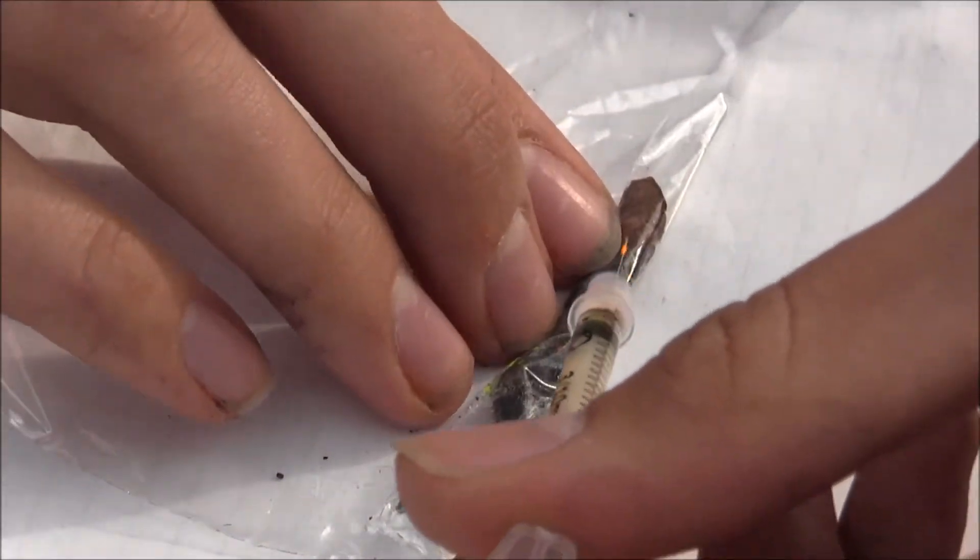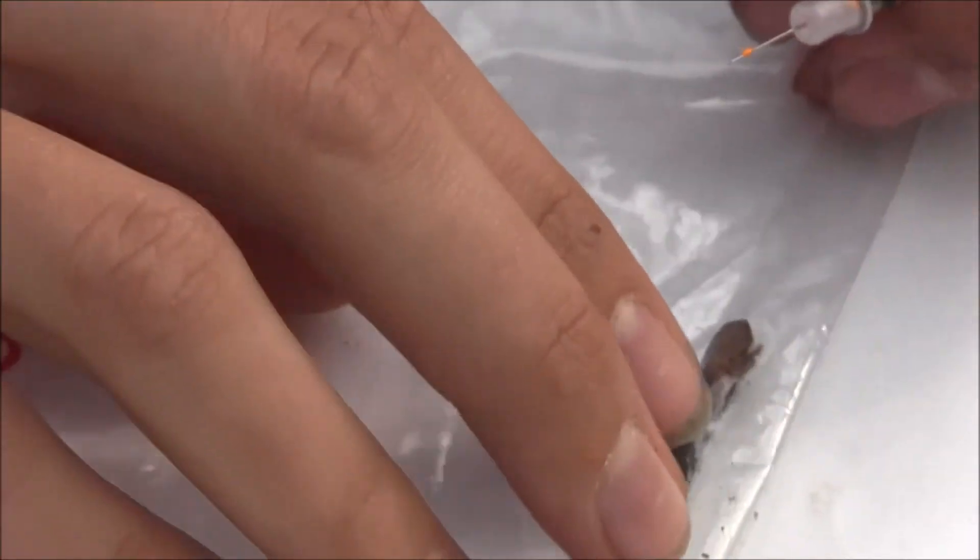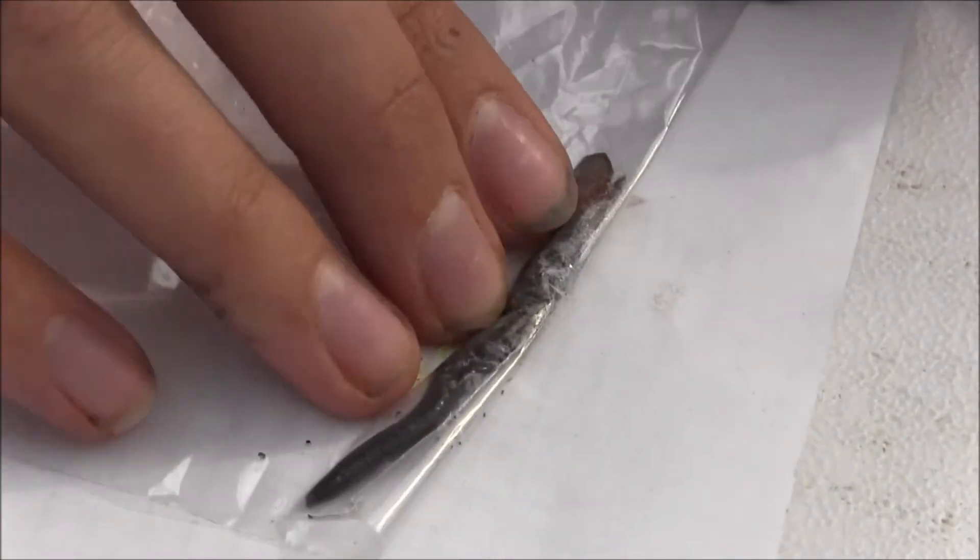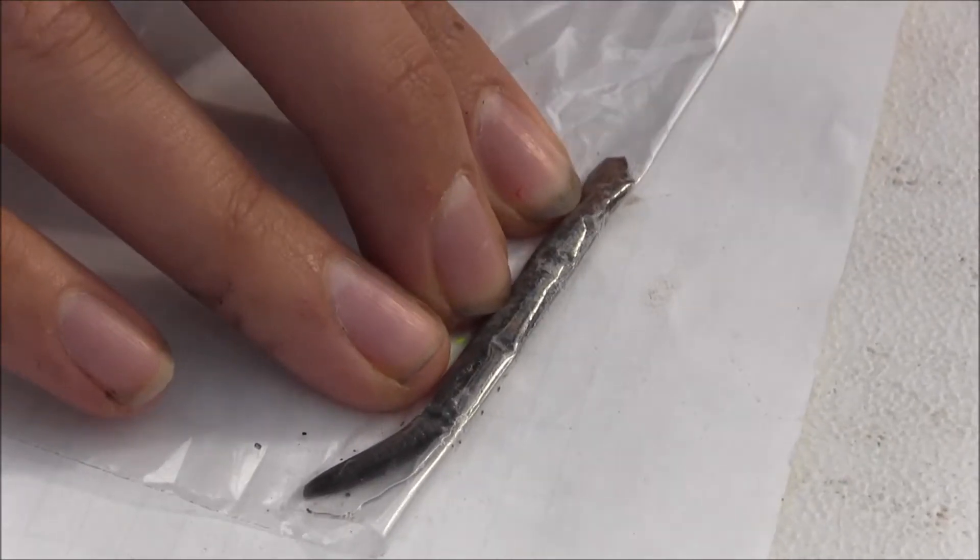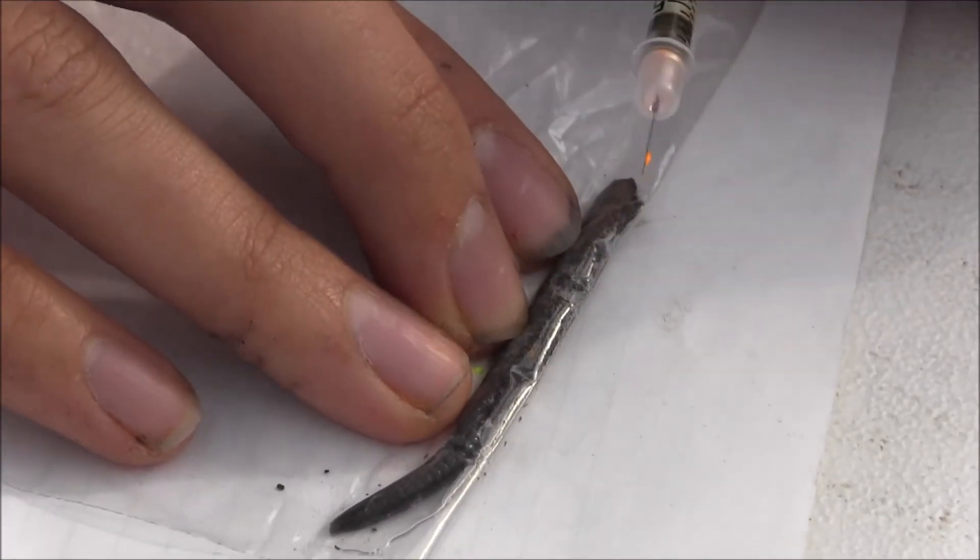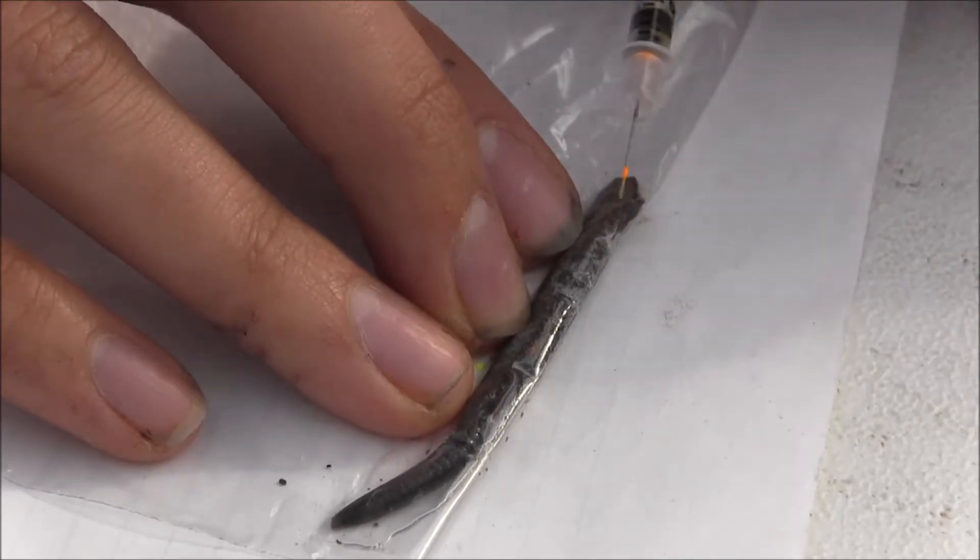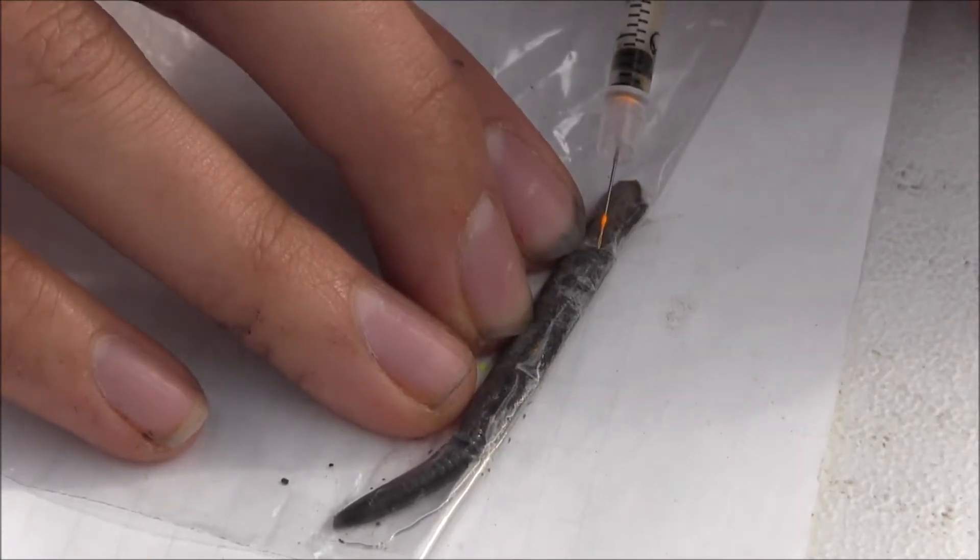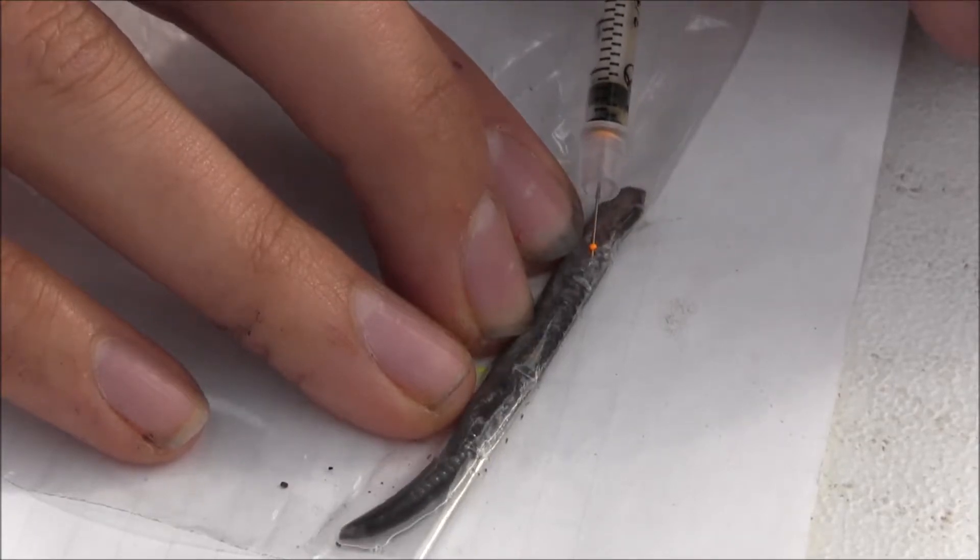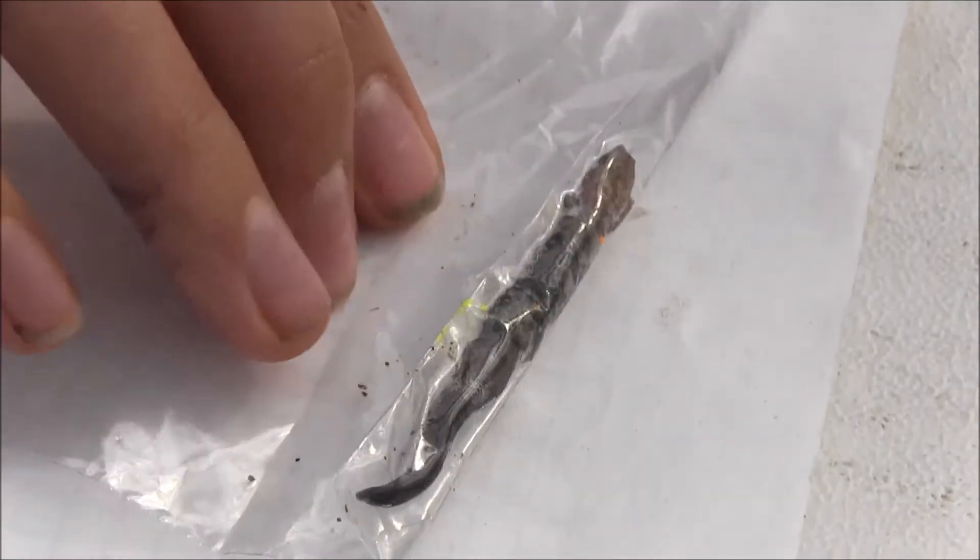Now, for the other side. What I'll do here real fast is get his arm out of the way, so that way position two is clear. Sometimes easier said than done. So, get him back now, and his arm is above his head. Find position one. Get the needle under the skin. Gently apply pressure. And we're good to go.